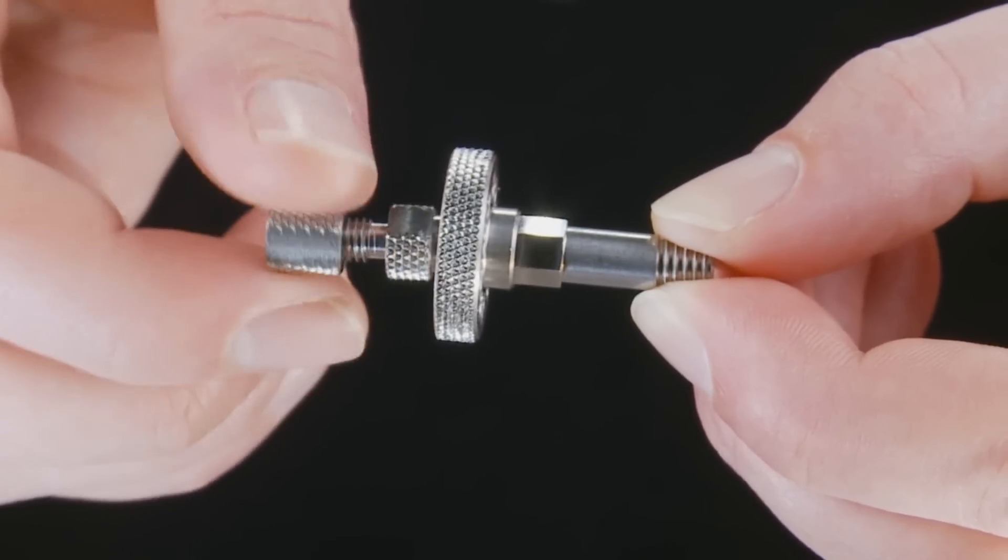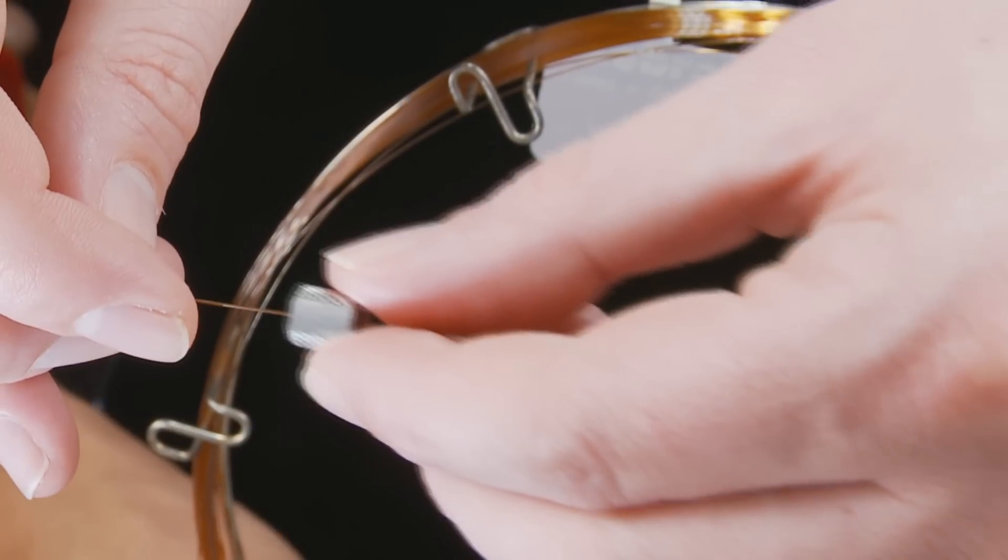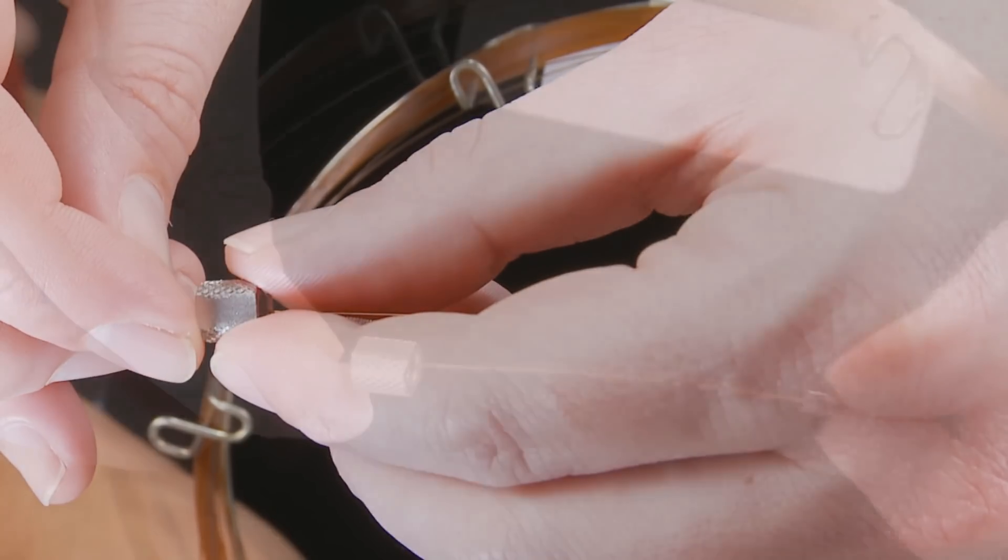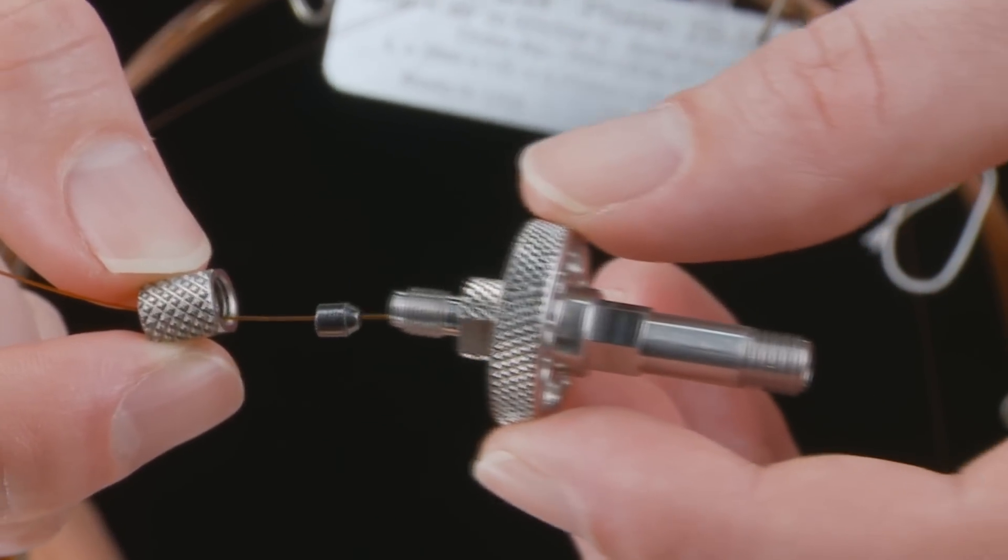First, remove the securing nut from the bottom of the cool lock nut. Insert your GC column through the securing nut, lower ferrule, main body, and upper ferrule.